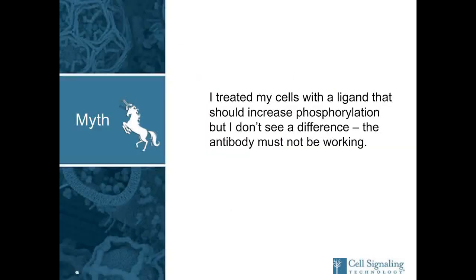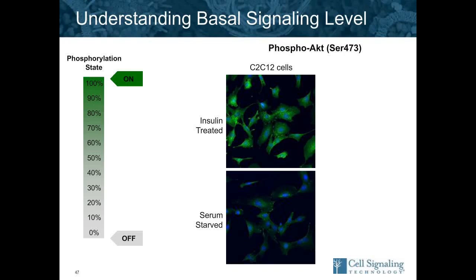The next myth is, I treated my cells with a ligand, and I should see an increase in phosphorylation, but I don't see it. The antibody must not be working. Often when we hear this, it's more a question of where the level of signaling is at a basal level. So you can see here in these C2C12 cells, if we serum starve them, as on the bottom, you see very little stain, and when we treat with insulin, you see lots of stain.